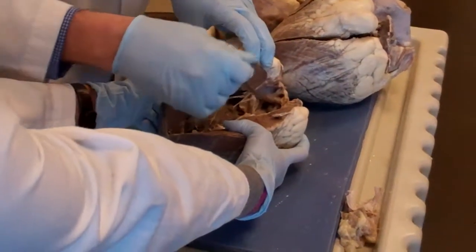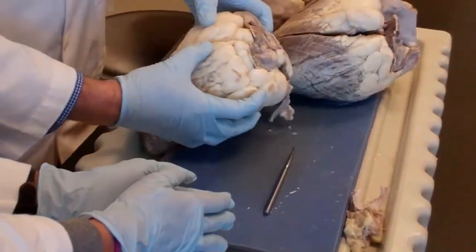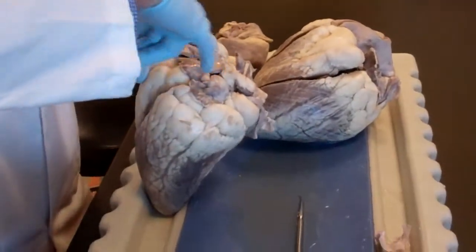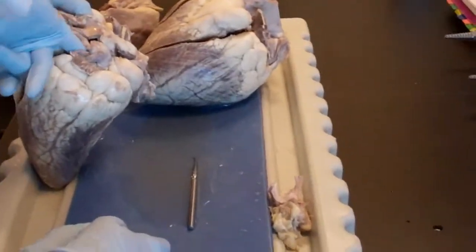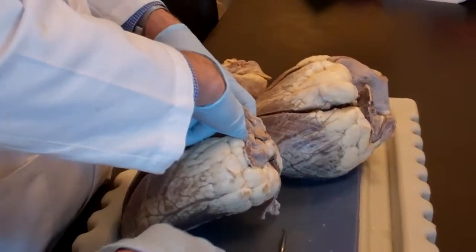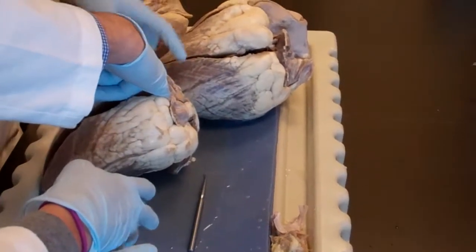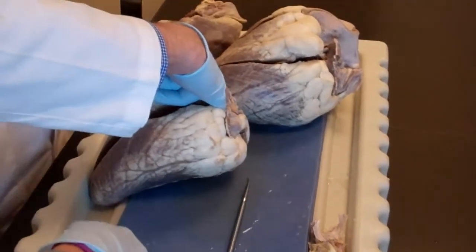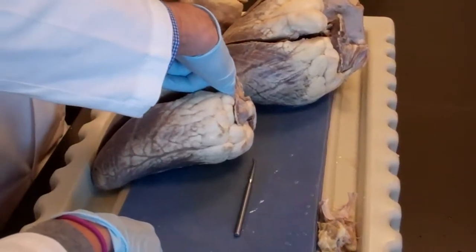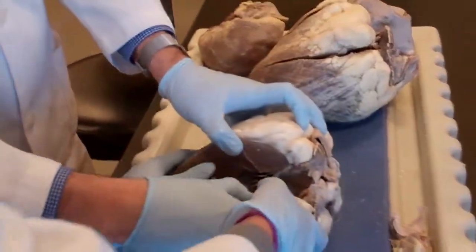Okay? Now, how did I know that this is the left side? I have to prove it. If I go with my little finger in there, I see a big cavity, okay? And that cavity should be, according to my measurements, the left atrium. So if it's the left atrium, and I connect to the left ventricle and I see a valve that has 2 leaflets, I am in the right place, yes? So I am going to go down, obviously, because this is open. So go ahead and open again.